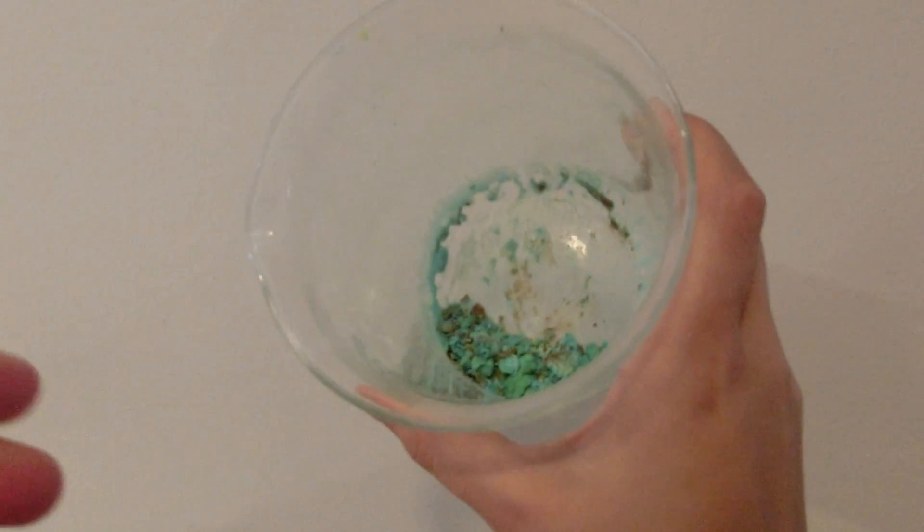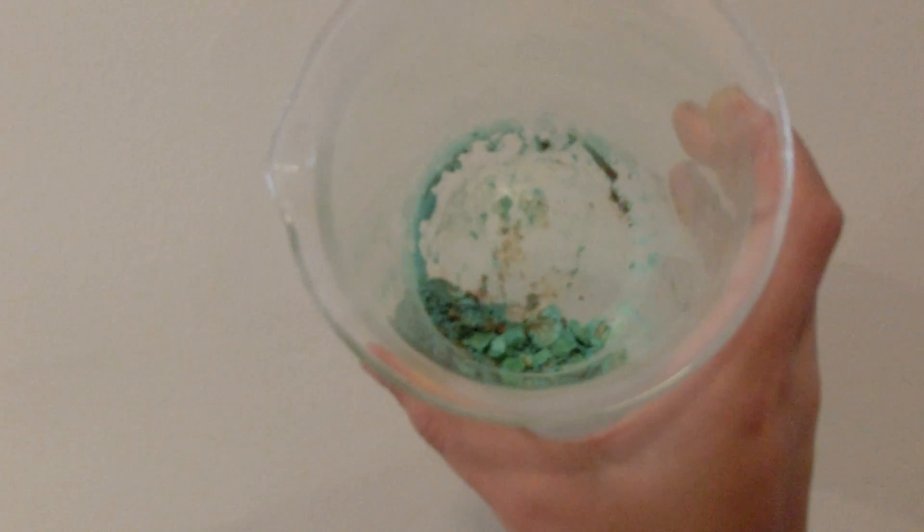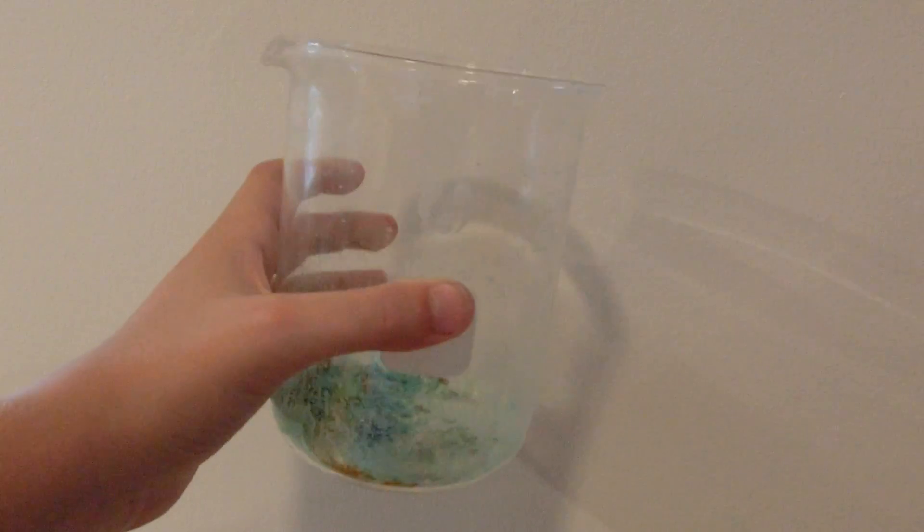Here is the final product. At first, it may be very green-browny, but as it starts to react with moisture in the air, it will become much more blue.